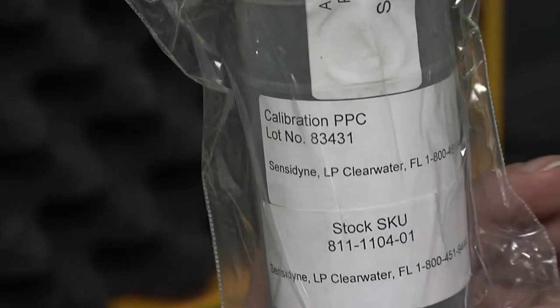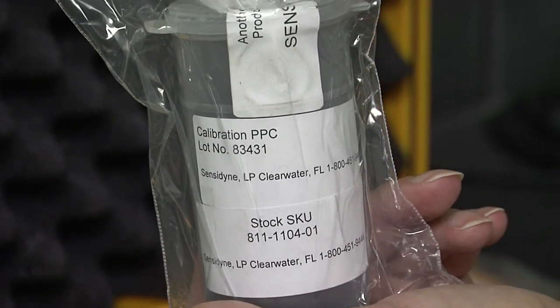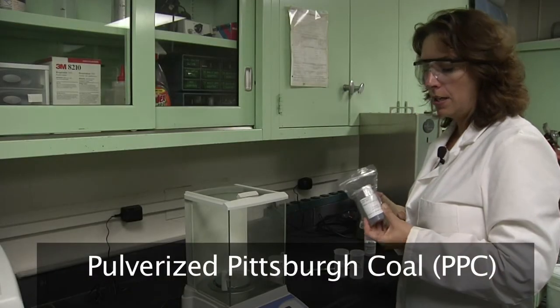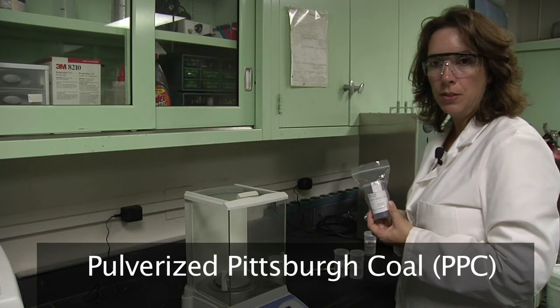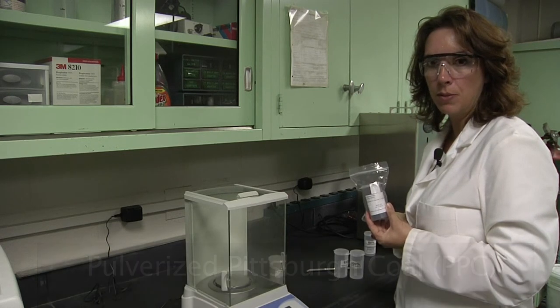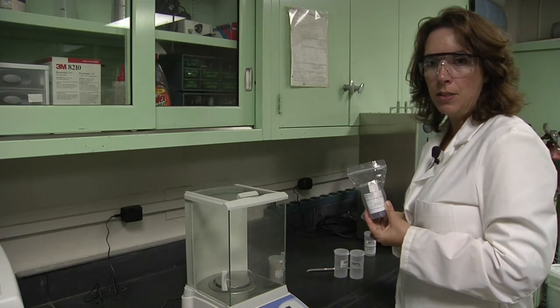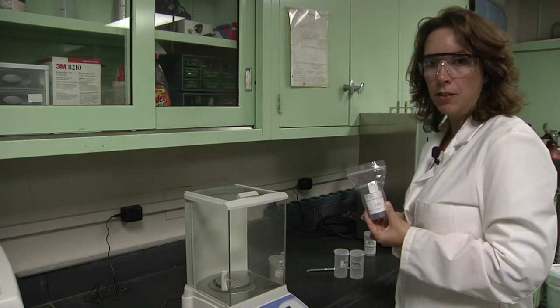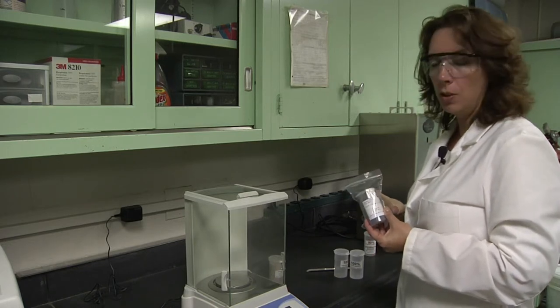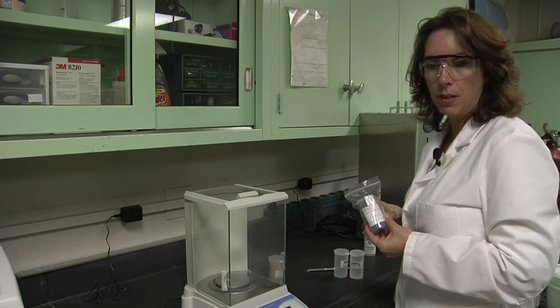Included in your kit is PPC. The PPC is pulverized Pittsburgh coal. It has a certain designated particle size distribution that has been used in full-scale explosion testing. You only want to use this PPC unless otherwise directed.